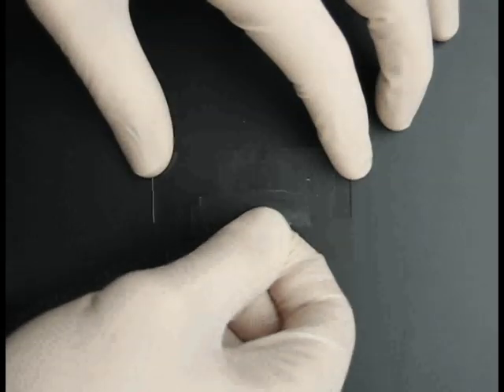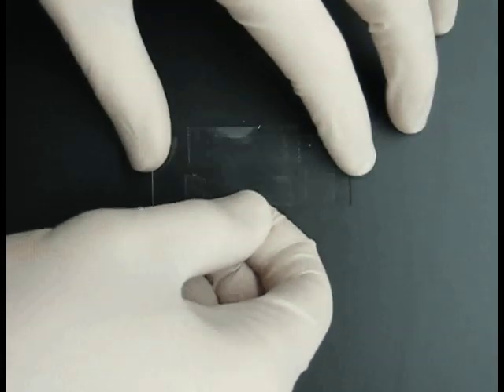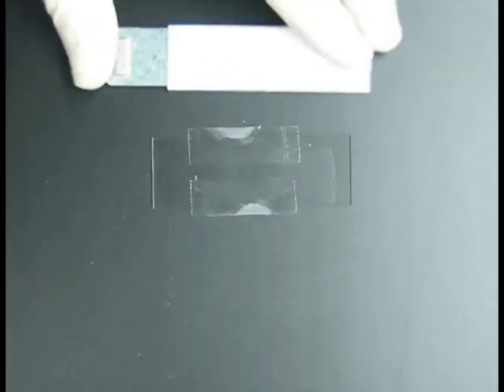Take your slide and position it in a manner that you feel will be comfortable for you to place tape on it. We use the Scotch brand permanent double-sided tape. Take a piece of tape about 1.5 inches long and attach it to the slide, as seen in the movie. Turn the slide around and do the same thing with another piece of tape. Try to position the second piece such that you can make an appropriate size channel for your experiment.